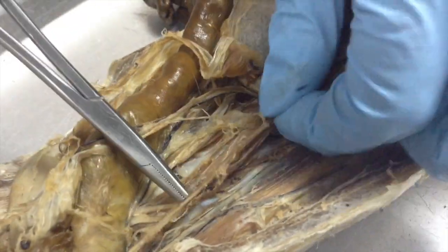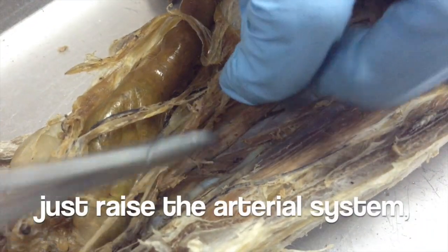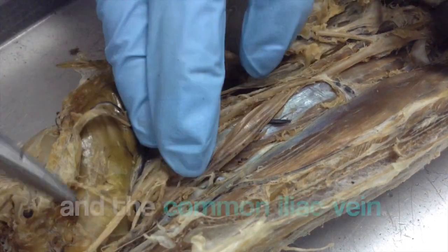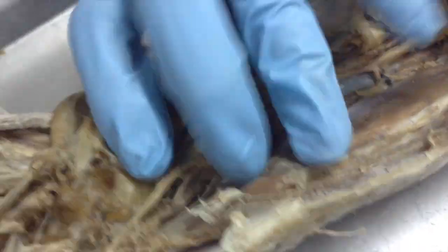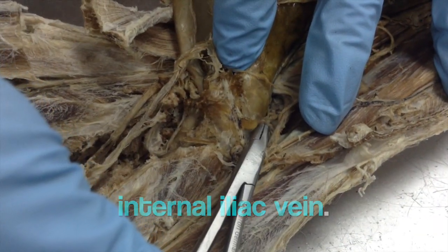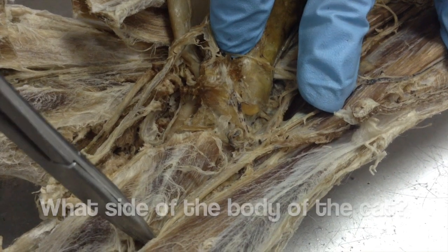Note that the arterial system lies on top of the venous system. This is the dorsal aorta lying on top of it. If we trace the common iliac, lift the arterial system — the dorsal aorta — you can clearly see the ilio-lumbar vein, the post-cava vein, the common iliac vein, and the left common iliac vein. Here is the external iliac vein, and inside is the internal iliac vein.